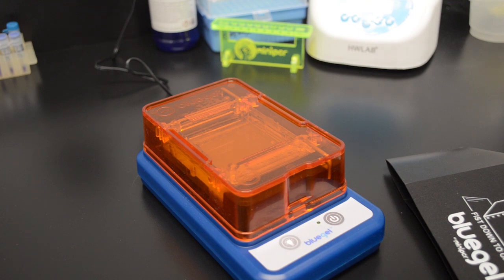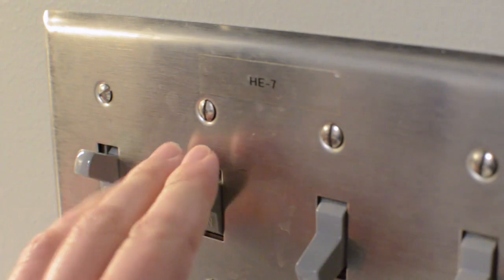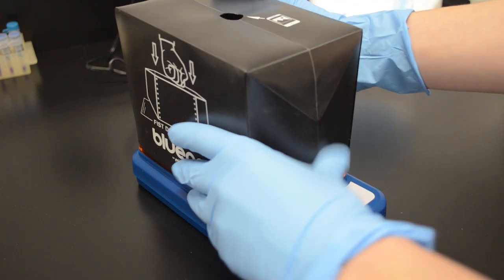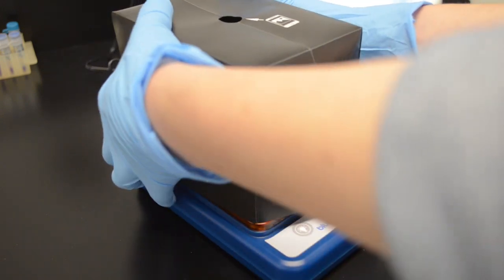If DNA is not easily visible, dim or turn off ambient light. You can also use the supplied photo viewer.